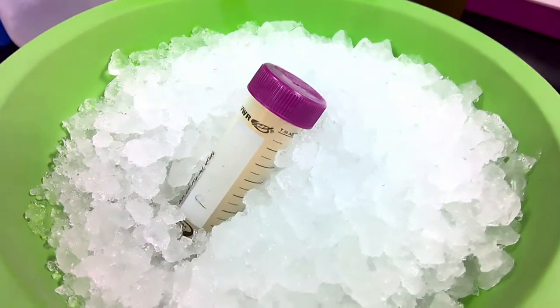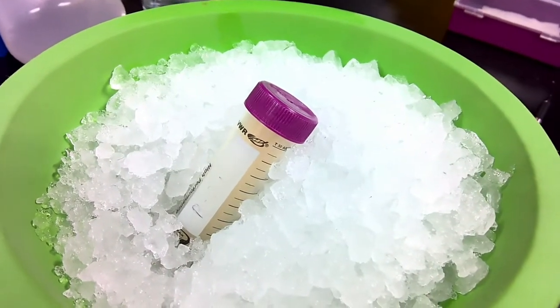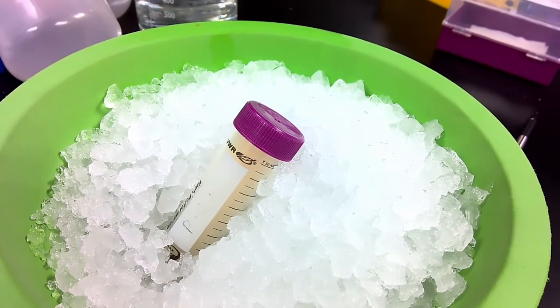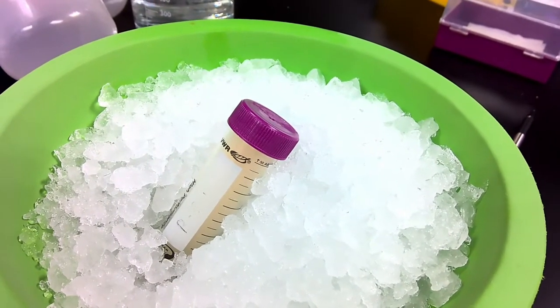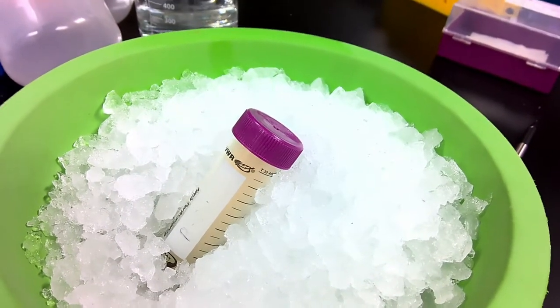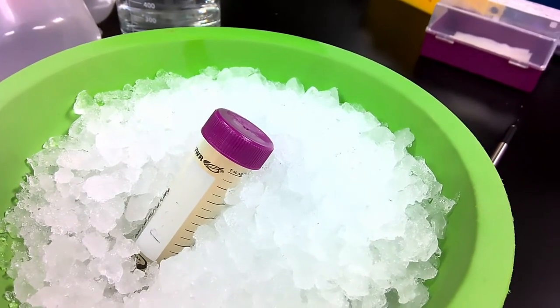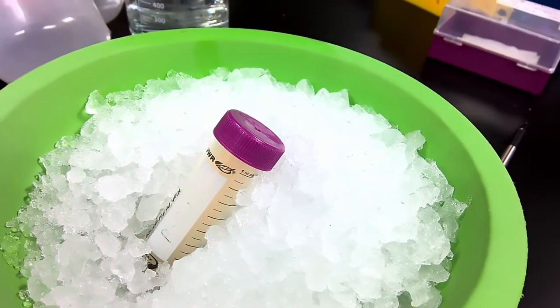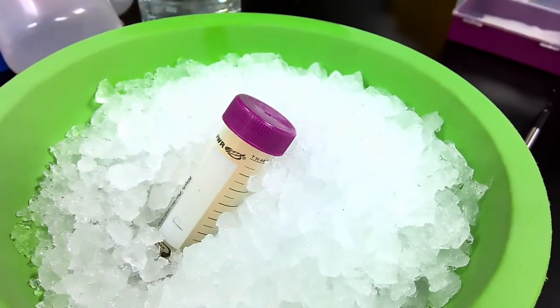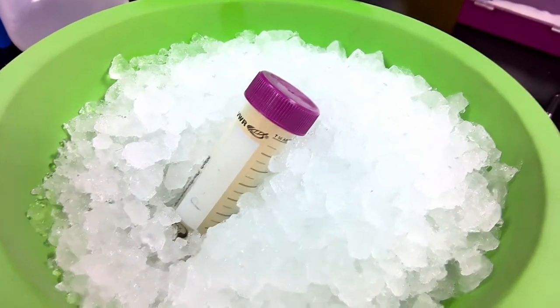Alright everyone, so it's now the next day, and I just want to let you guys know what I ended up doing last night. Remember, last night I threw this in the hula shaker. I let it spin for about an hour and a half, at 4 degrees Celsius, so that the lysozyme could completely mix with the resuspension and slowly break down the peptidoglycan layer. However, that's really not enough to completely lyse our cells. So what I ended up doing next was starting a freeze-thaw cycle.